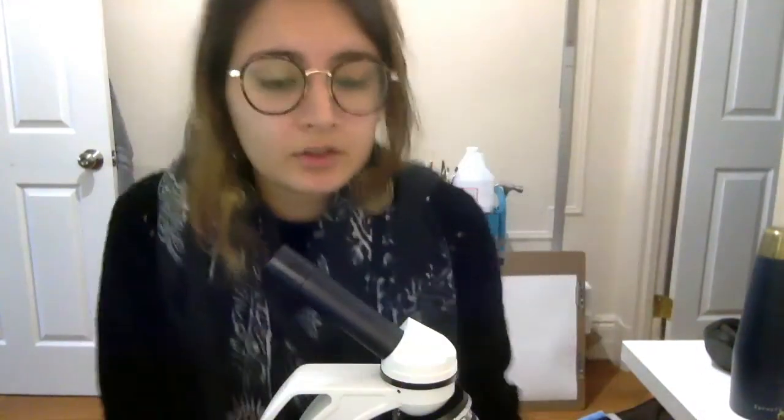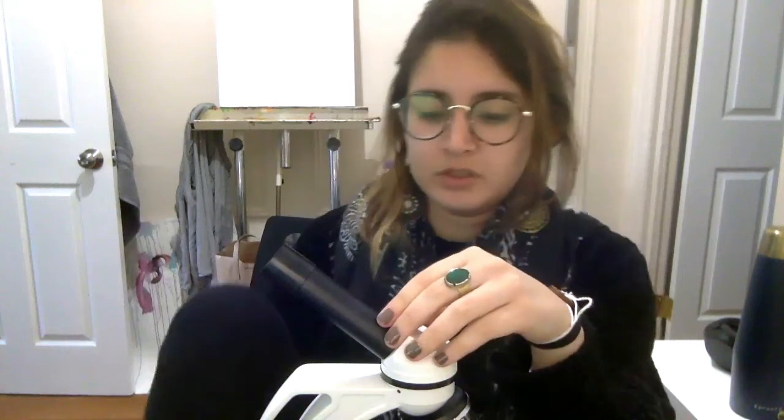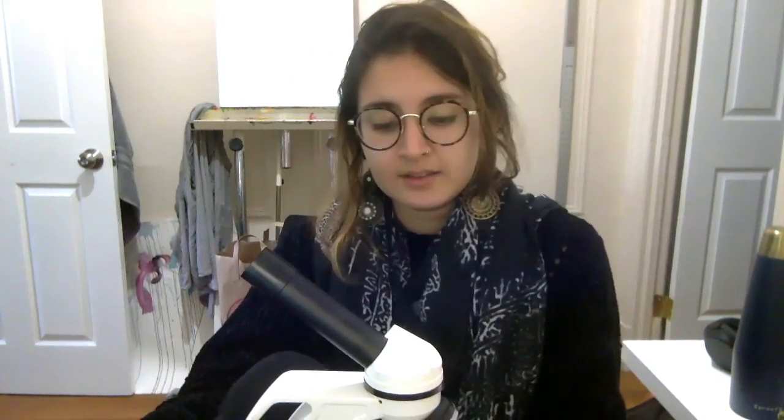So parents, if you're looking for a fun and educational toy for your kids, this tool is really great. You can find some cheap ones online. You can also find some that can connect into your computer. It's not your traditional microscope, but instead it looks like a little pod that you can move around. So this is a really great way to get your curious kids into some science and to teach them how to look at the world differently.